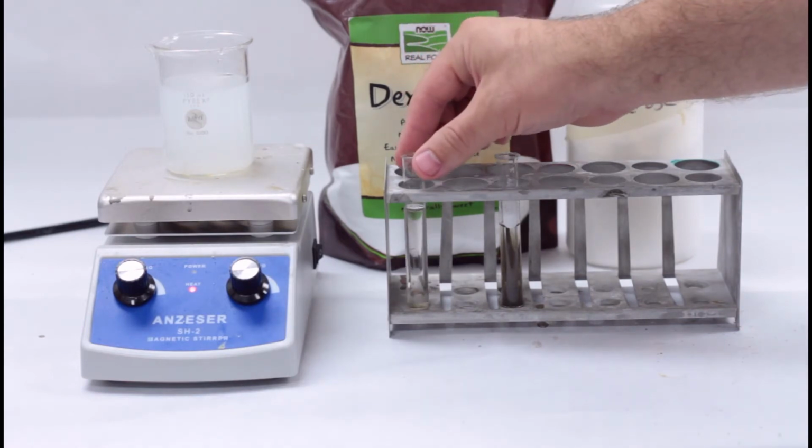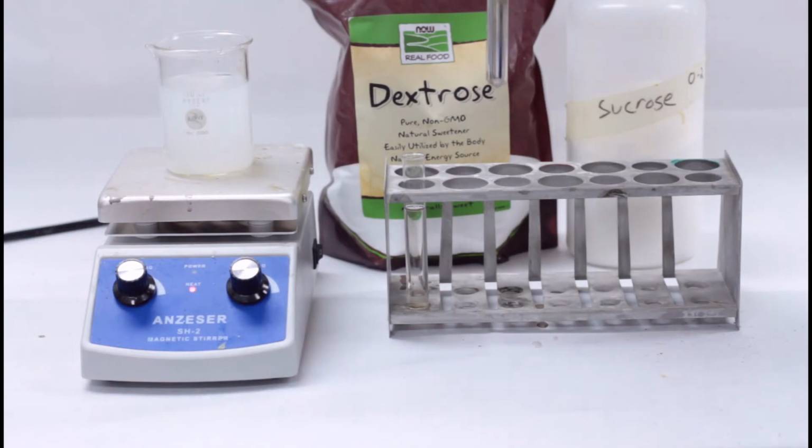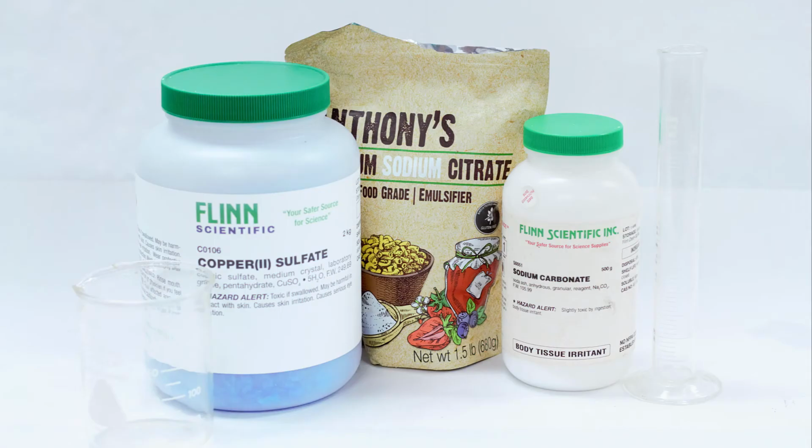We will start by making the Benedict's reagent, and while you're waiting for everything to dissolve for that, you can prepare the Tollens' reagent. You'll need boiling water for both tests, so once your reagents are ready, you'll place a 150 milliliter beaker with some tap water onto the hot plate and heat it up to at least 75 degrees Celsius. For Benedict's reagent, you'll need sodium carbonate anhydrous. That means it doesn't have any water in it.